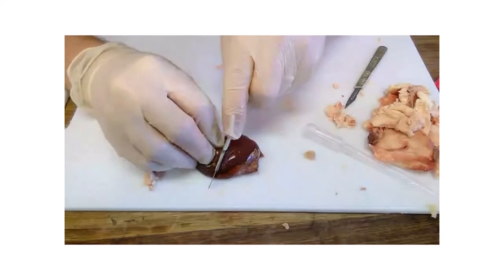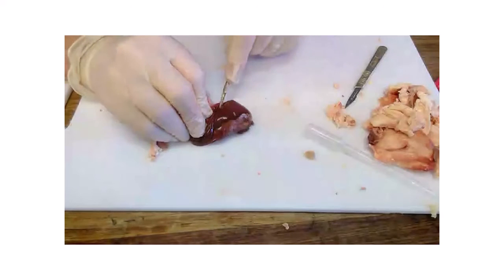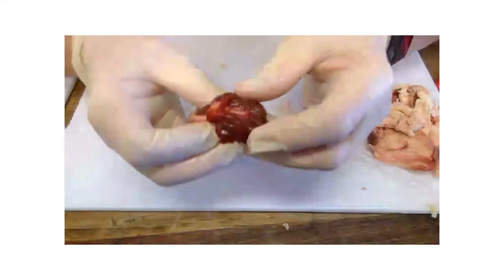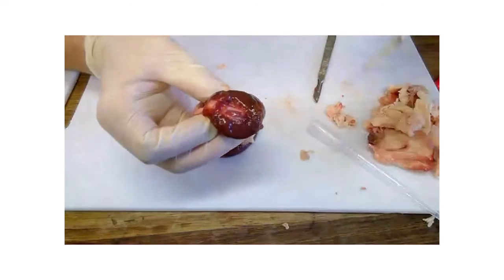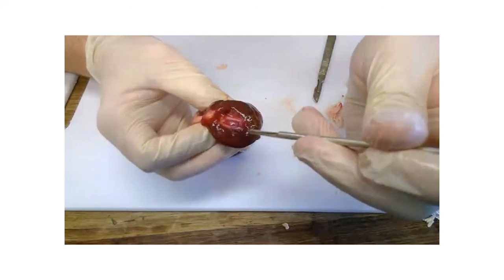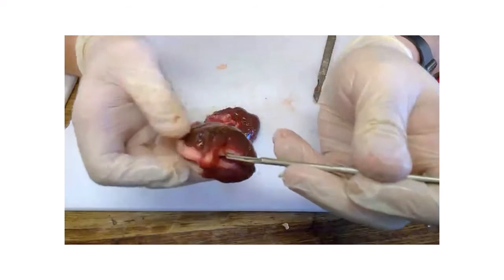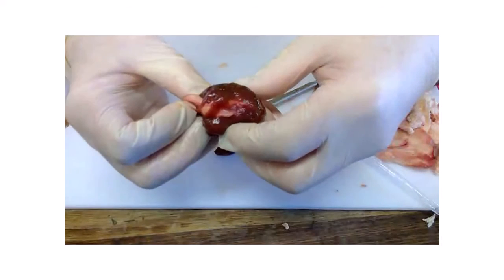So I'm going to cut it crossways now, and you'll be able to see the different layers of tissue on a different plane. So there you've got the cortex around the outside where the glomeruli are, and there you've got the medulla where the loops of Henle are, and then the pelvis which it all drains into. And it drains away and goes down the ureter to the bladder. So that's what we call the gross structure of the kidney.